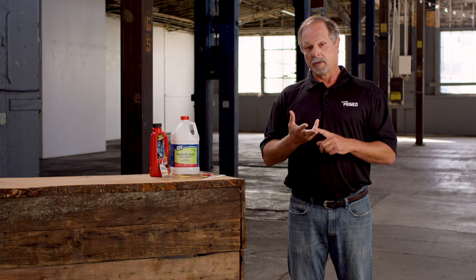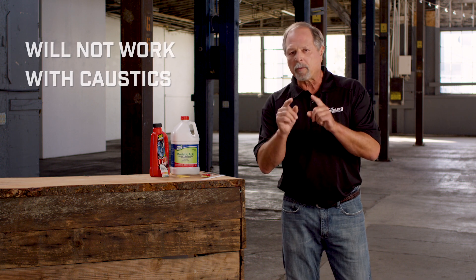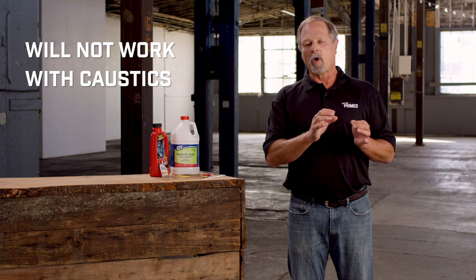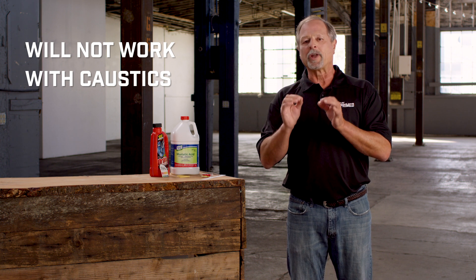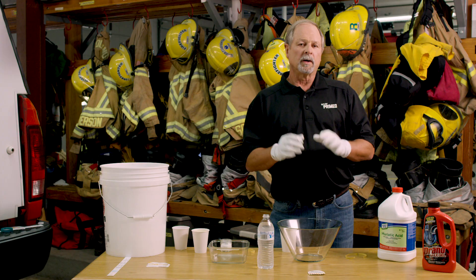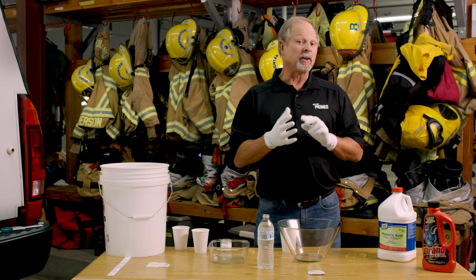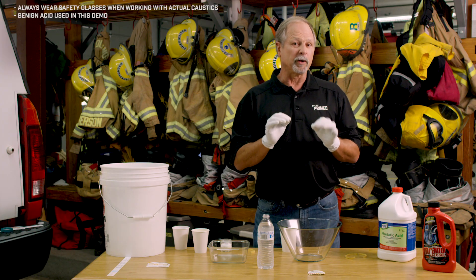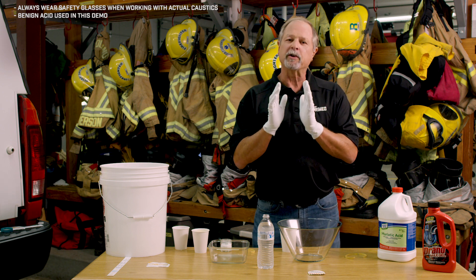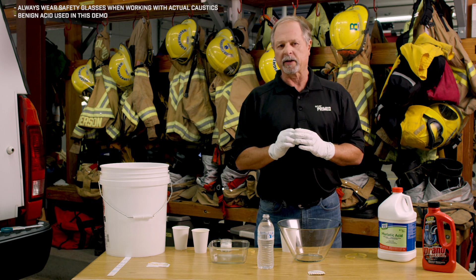In the hazmat field, we have a statement that says dilution is a solution to pollution. That just means washing stuff away, diluting it to where it's not harmful anymore. That will not work in the case of caustics. Adding a lot of water to some caustics will not dilute it to where it's not hazardous anymore. Let's demonstrate that right here.